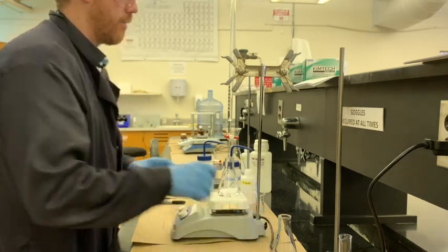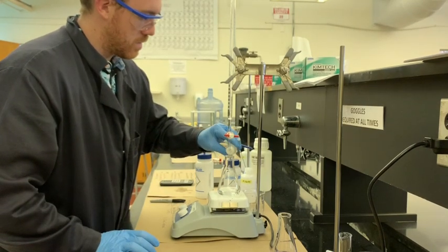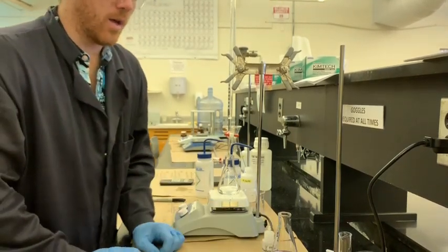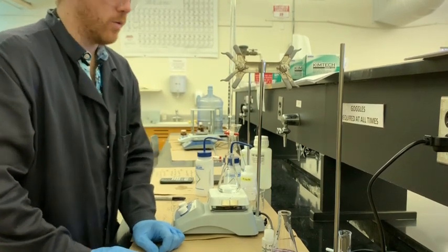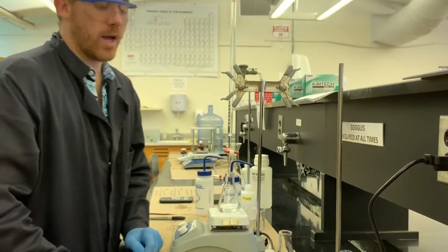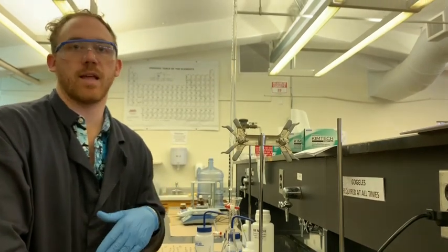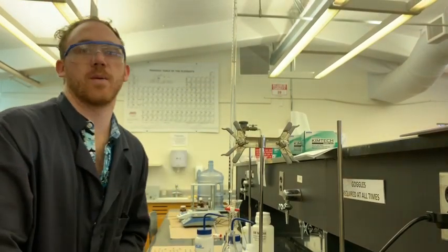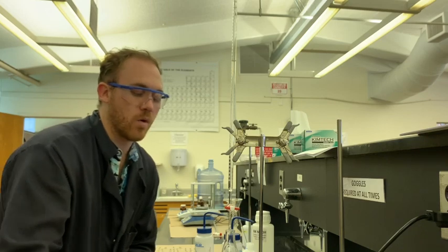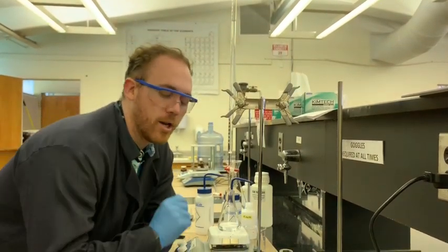Our second sample, burette is ready to go. And we're going to add the phenolphthalein. Should have probably added it before I put it in place, that's fine. Put in 3 drops. And the last time I used about 11.09 milliliters. But if you noticed, we actually ended up with 0.704 grams of KHP versus 0.509. So this one's going to take a little bit more. Normally you can use roughly how many milliliters you used before to allow yourself to skip past a few milliliters so you don't have to check every single drop very carefully. And it'll help you speed things up a little bit. So we know it's going to be more than 11 milliliters for sure of the NaOH solution that we have in here, which is homogeneous, right? So let's get started.